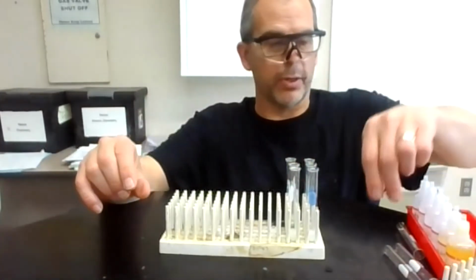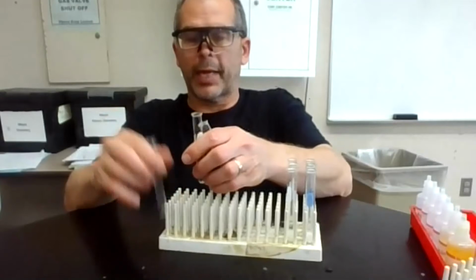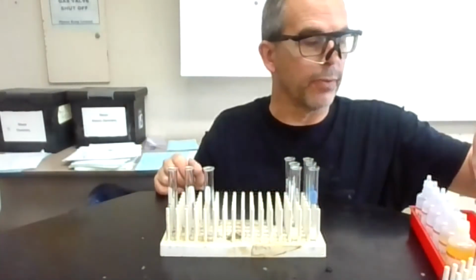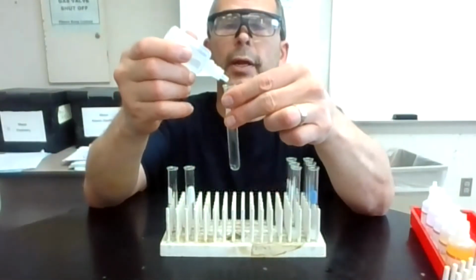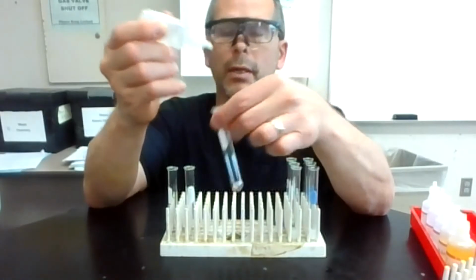And let's go to the final column of our data table. And usually, if I were back in lab, I wouldn't probably have that many test tubes. I'd probably flush out my test tubes and go to the next one. But we want to do this in a video and do it pretty quickly. So I'm going to do my 10 drops of silver again. Ooh, that looks like there's extra water in there. So 1, 2, 3, 4, 5, 6, 7, 8, 9, 10.